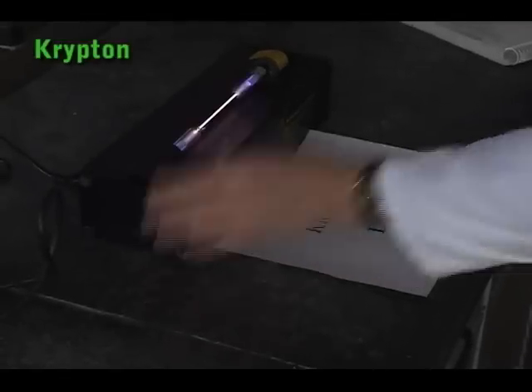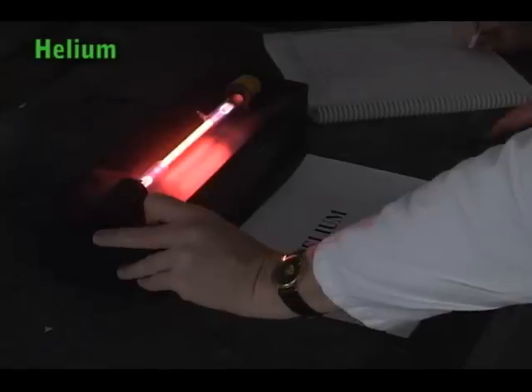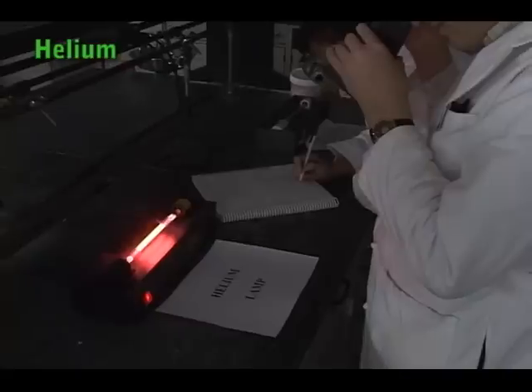One person can observe the spectrum and read off the measurements while the other person records. Switch responsibilities often so you can both practice using the scope. Take turns viewing the different lamps around the room. Record the spectral data carefully for each.